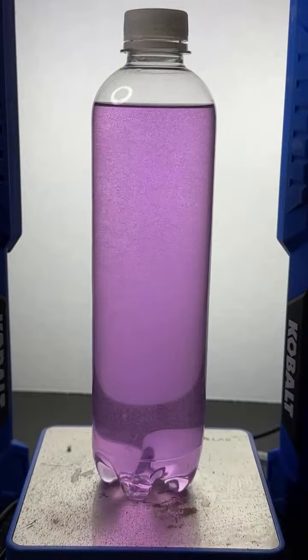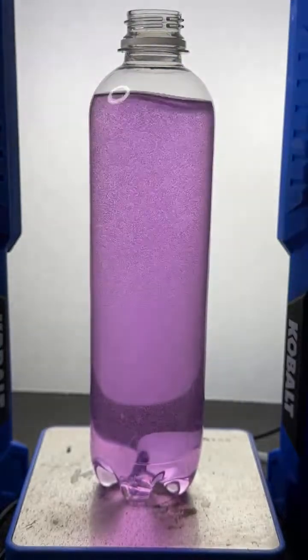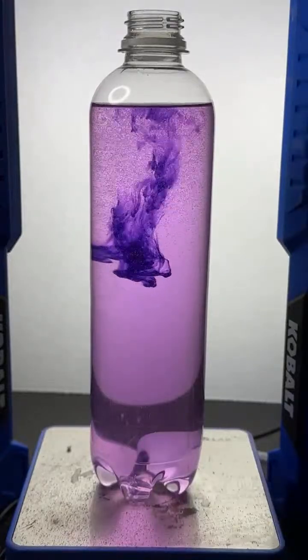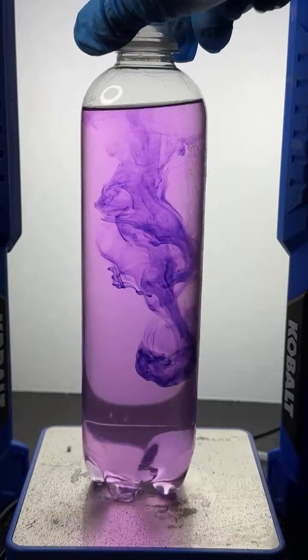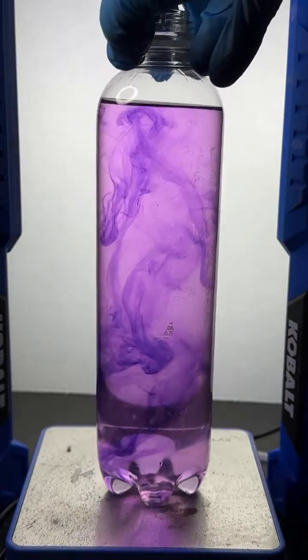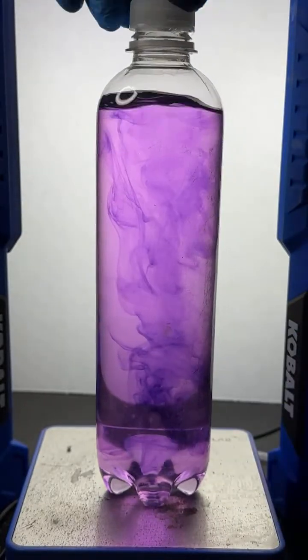I think I'm going to add one more drop of dye. I just want a bit more color in this. All right, so here goes another drop of the dye. We can actually tell that this indeed... Oh, that's pretty. Man, is that pretty. And this time we probably will see the dye go all the way down to the bottom because the fluid is homogenized in this case. Sure enough. So you can tell in this case that the water and the alcohol had been thoroughly mixed. We don't have that separation that we did last time. All right, let me go ahead and mix this up. And then we're going to add our white solid. And we're going to see what happens.